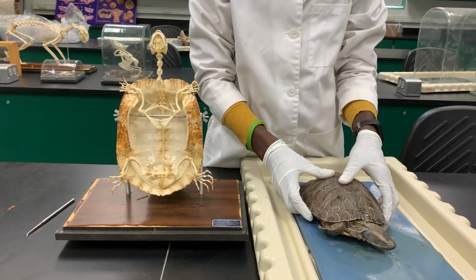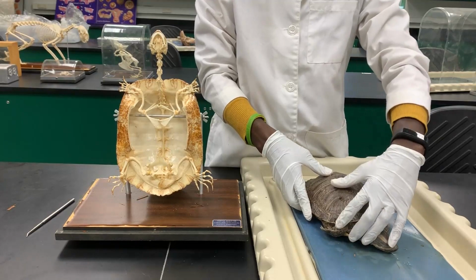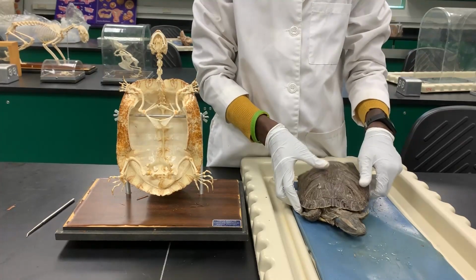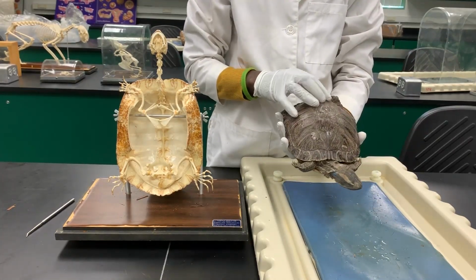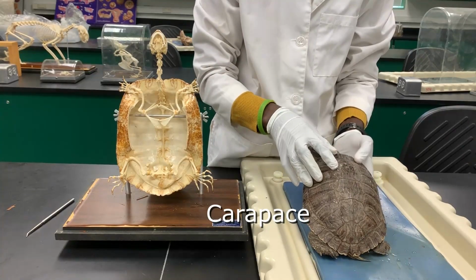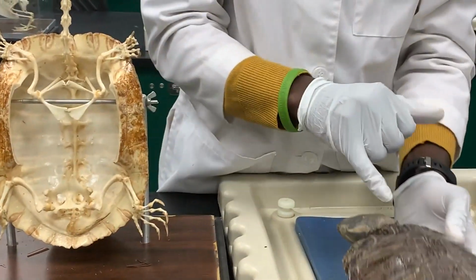So moving on to the exoskeleton, we'll be looking at the different structures that you can find there. Most of the body of the turtle is enclosed in an encasement, and on the dorsal part of that is what we call the carapace. The carapace has these keratinous scutes, and they are lined.